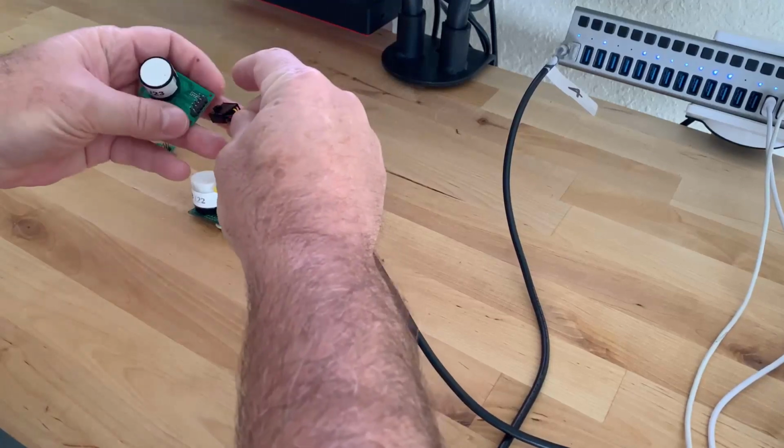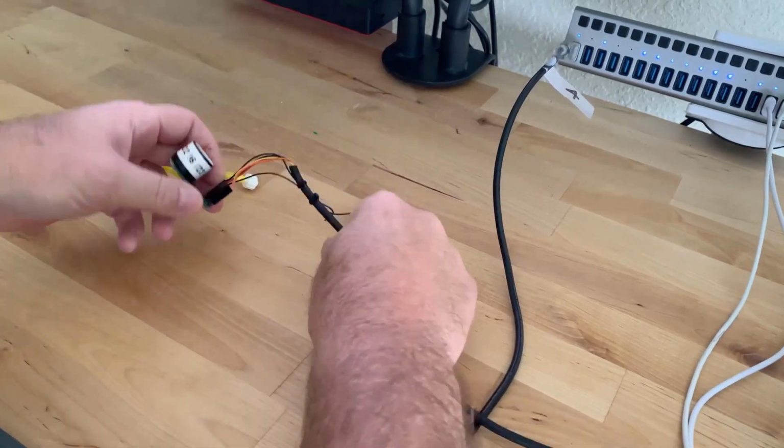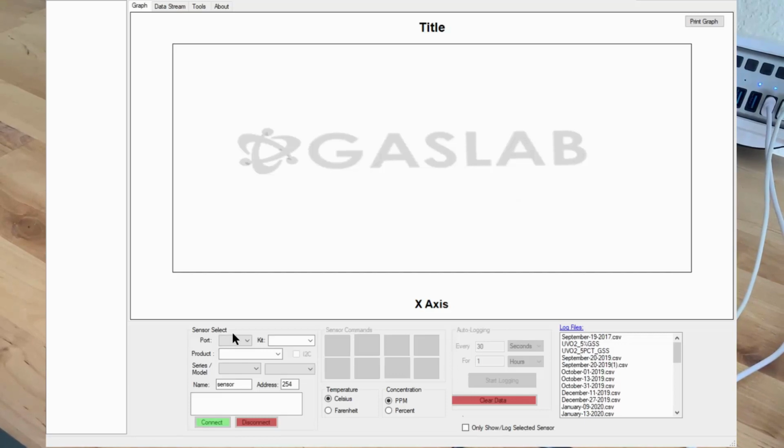Let's say we want to verify what addresses whoever is on. So we hook up this USB to RS485 cable. This happens to be set up as a 5% CO2 at address 6. We are on COM port number 4, which is a USB connection from a hub. If we want to see if we have the right cable or not, we simply unplug it and it will go away, and we plug it back in and that guy will reappear. So we're going to pick COM port 4.